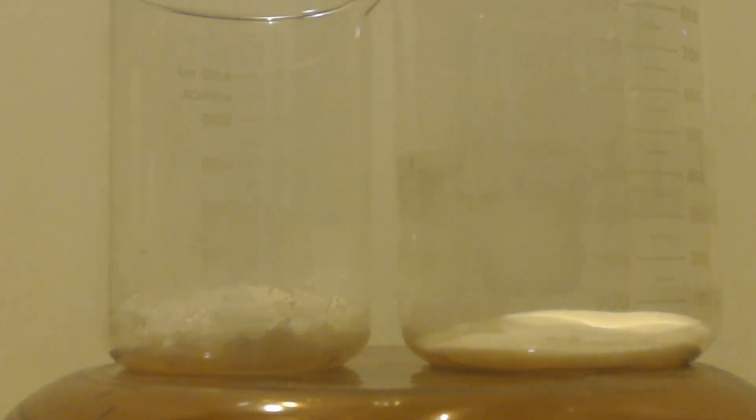This is John Black Superchemist. We're here to make some silver nitrite. Not nitrate, but nitrite with an I.